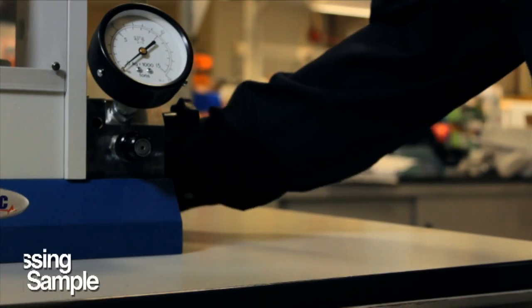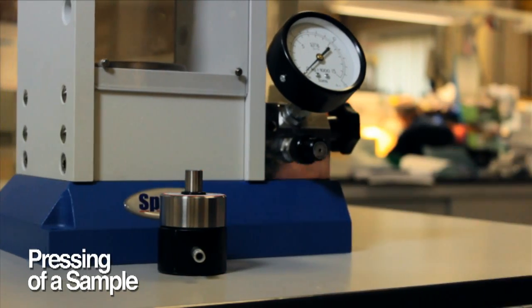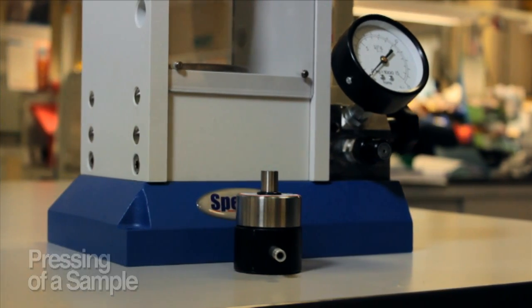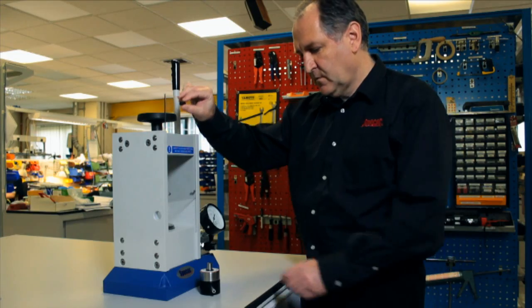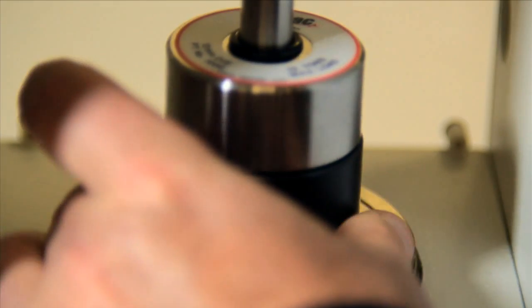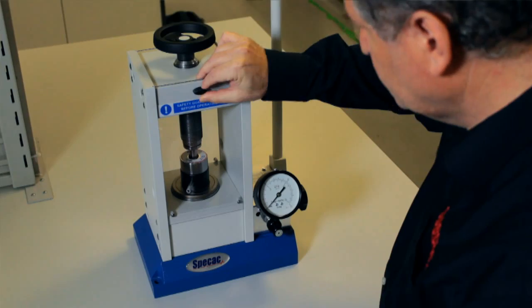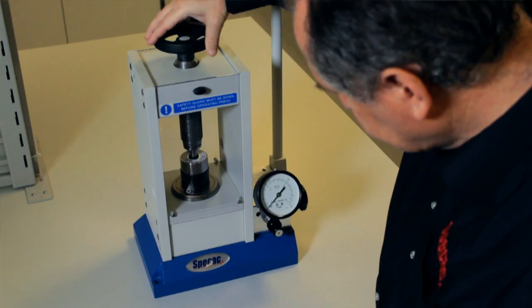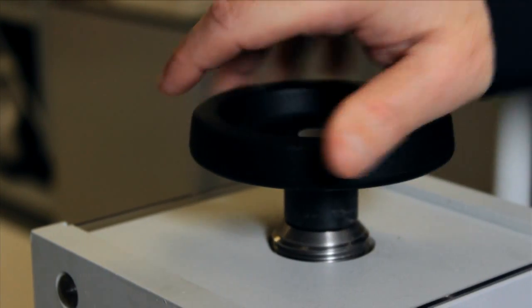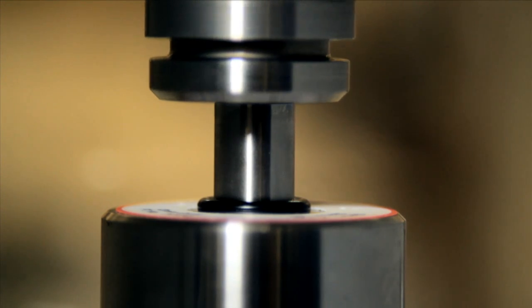For a typical pressing of a sample, we are using the 13mm die assembly as an example. Raise the front safety guard and place the die to be pressed on the lower bolster pressing face covering the piston. Ensure that the work is positioned centrally and lower the safety guard. Screw down the top bolster pressing face attached to the lead screw by turning the lead screw handle clockwise until the parts to be pressed have come into contact with each other.